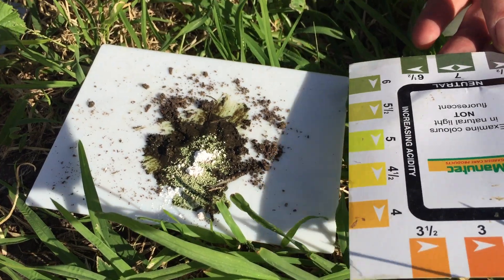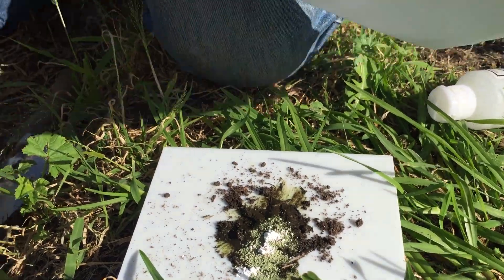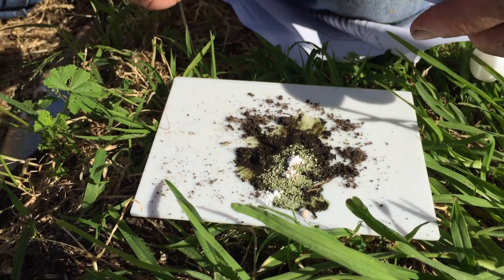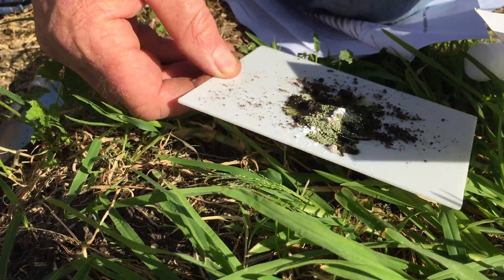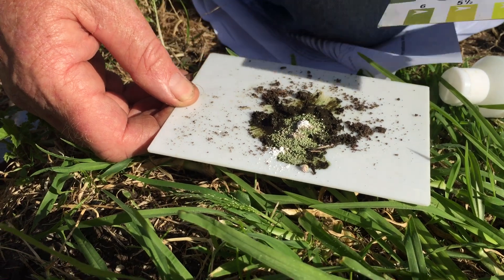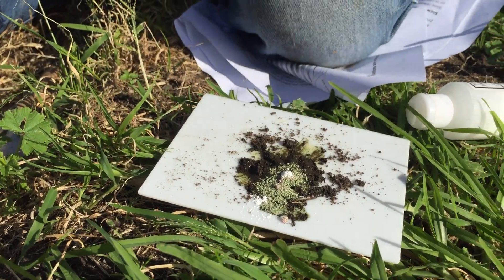Let's see if everyone can see that. What do you reckon? I'm going for a six. Yeah, I think you're right — six, six and a half. It's doing its usual thing — six to six and a half. Maybe even seven? We're going to call it slightly acid — perfect.